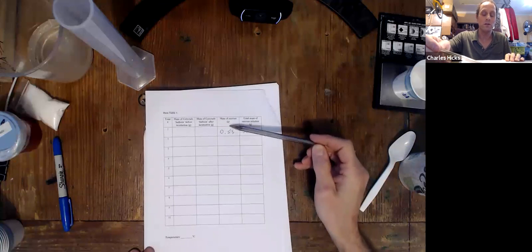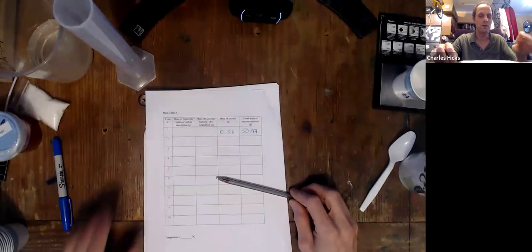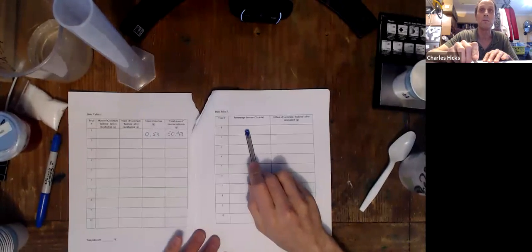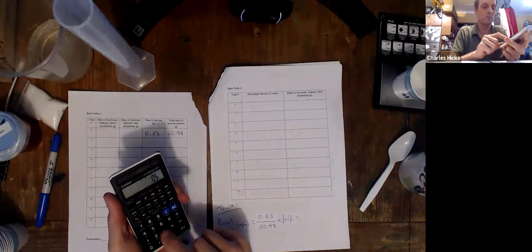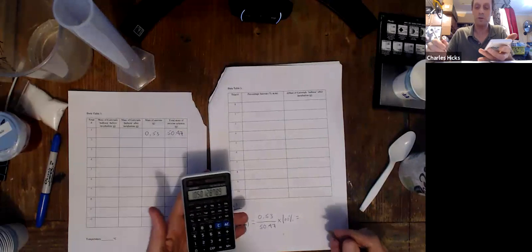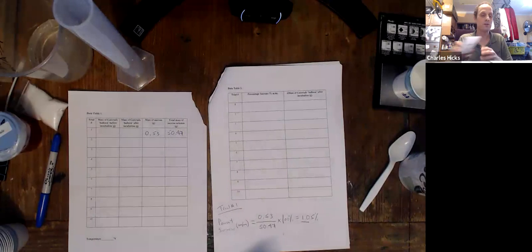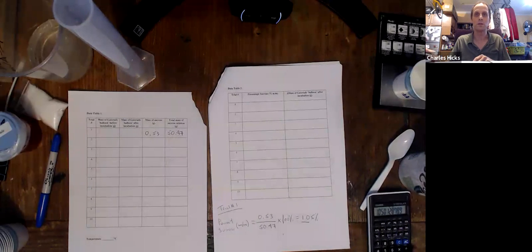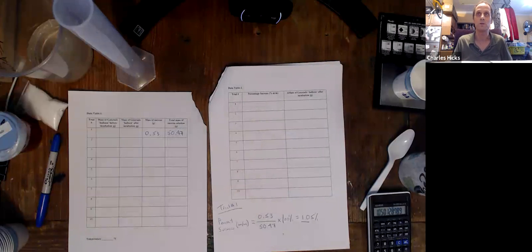You're going to repeat that procedure using different masses of sucrose for each of the trials to generate 10 different solutions in labeled Dixie cups. Each one of those masses is going to be used in the following data table in order to calculate the percentage of sucrose by mass. So it's these two numbers here that are going to calculate this percentage, and I'll take out my calculator. We were aiming for around 1%, and sure enough, we have about 1.05%. So you repeat this preparation and this calculation for all of those solutions. The solutions percentages should vary between about 1% for the first one and about 10% for the last one.